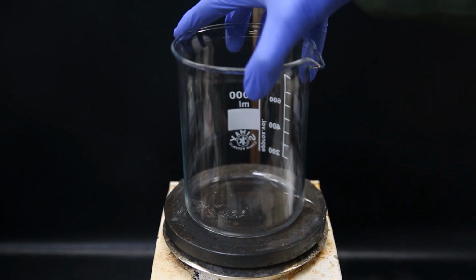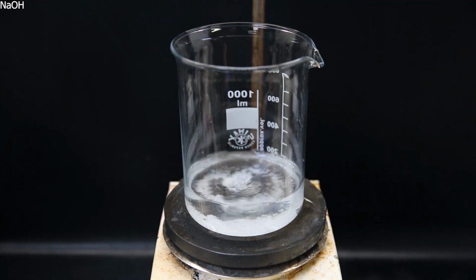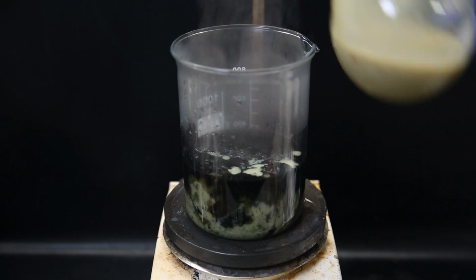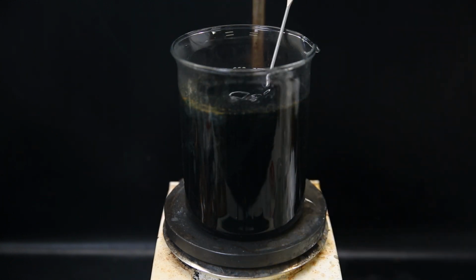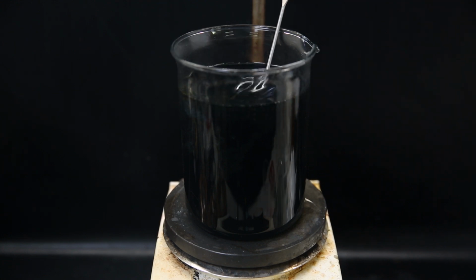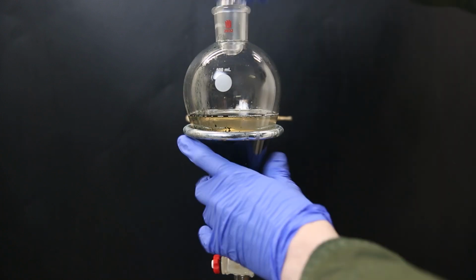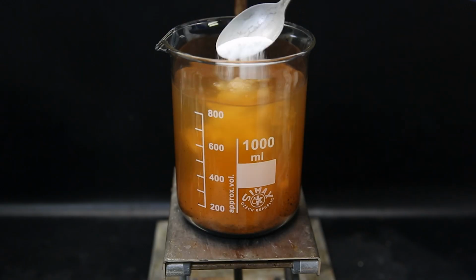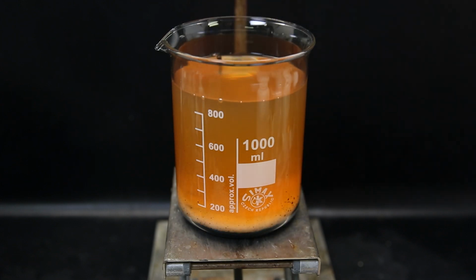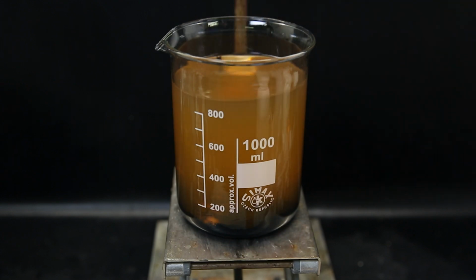So I set up a beaker, drop in a stir bar and add in 200 ml of water and a random amount of sodium hydroxide. I pour all of the reaction mixture into the beaker and a lot more of the iron salts precipitate out. I make sure that the suspension is alkaline by testing with a pH strip, and then move all of the suspension to a separatory funnel in portions and extract out the amine with ethyl acetate. I put the combined extracts in a beaker and add a bunch of anhydrous sodium sulfate to soak up the water and the iron junk that came along with it.